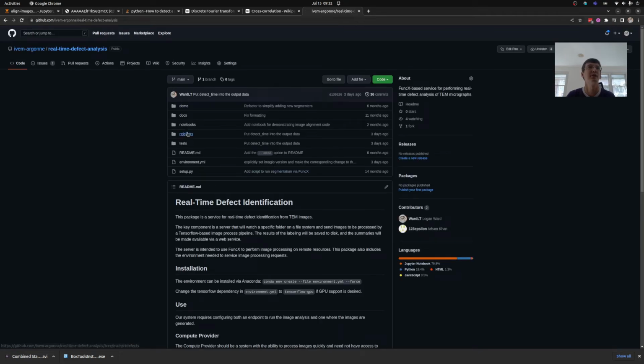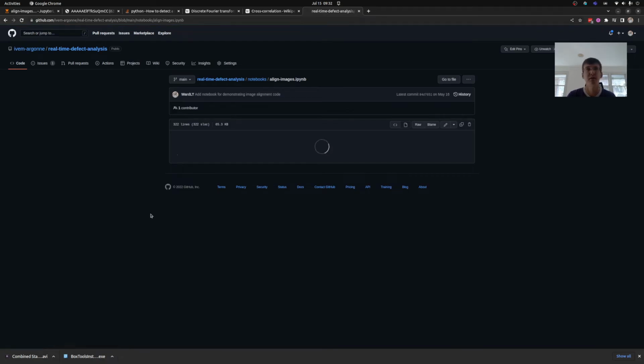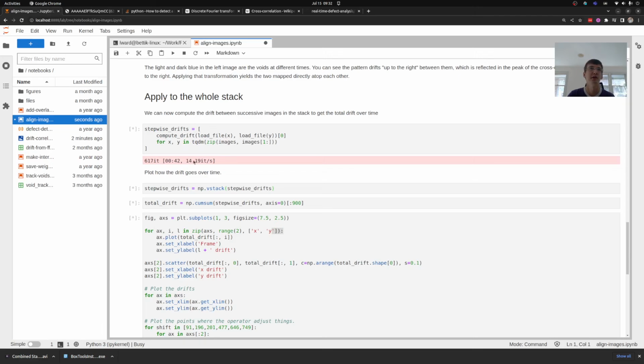This is up on GitHub, and I'll give you this link later. And yep, align images, and we'll see over time I can compute both the X and Y drift. And these vertical bars here show where my experimentalist colleague adjusted the microscope to counteract the drift. You can see that those line up well to where my code is detecting the very large drifts. So everything seems to be working here. This is going to take about a minute to run through. It does about 15 frames a second, so it's fast enough for me to do on an entire video.